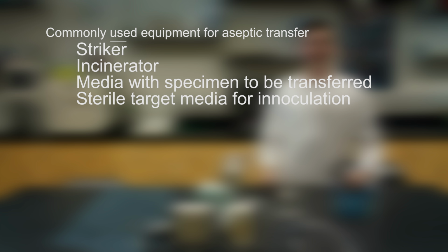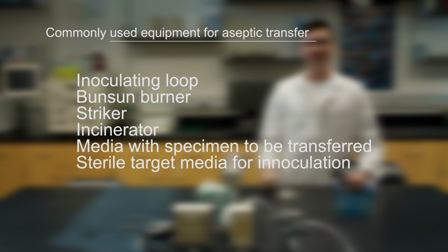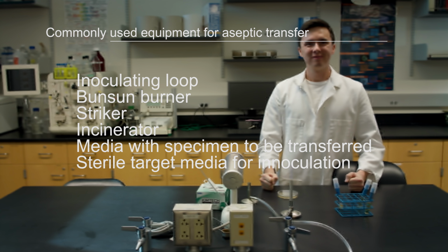This video will provide instructions on aseptic technique. Proper aseptic technique involves using a series of procedures while transferring organisms to prevent any outside contamination from pathogens.